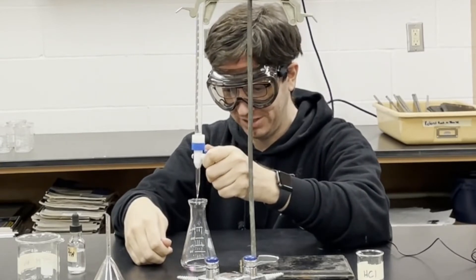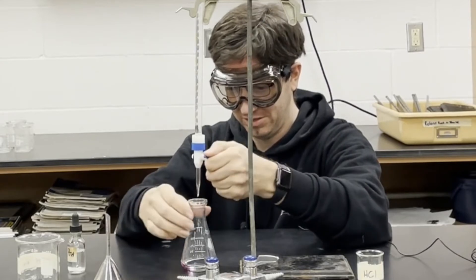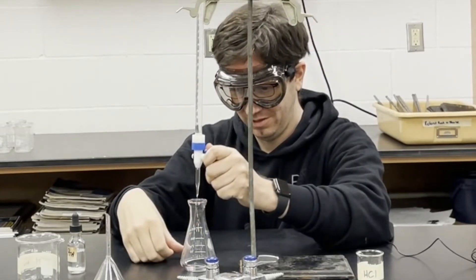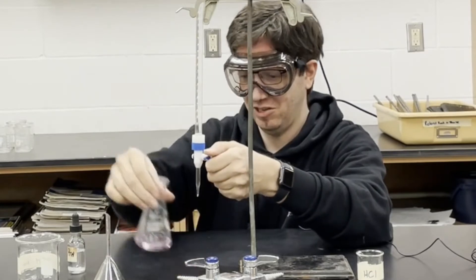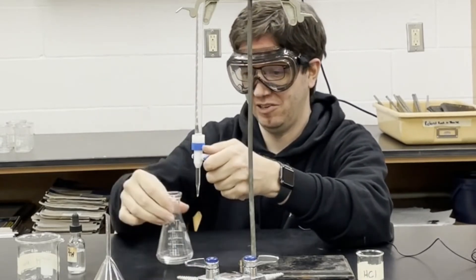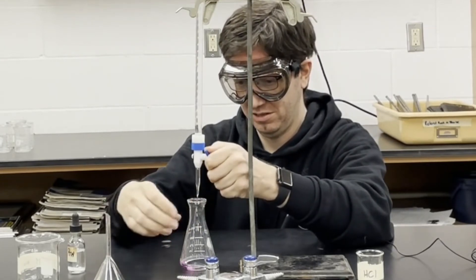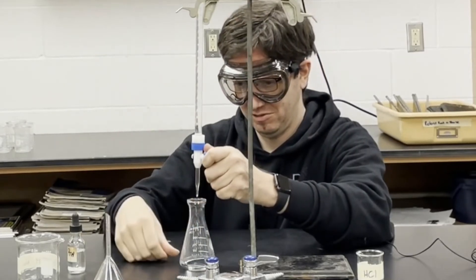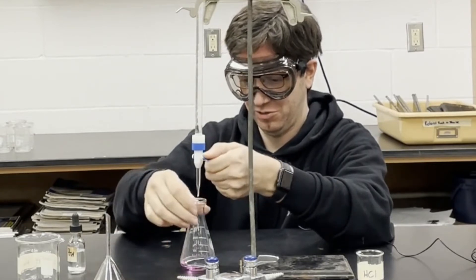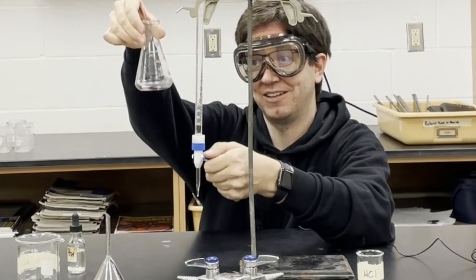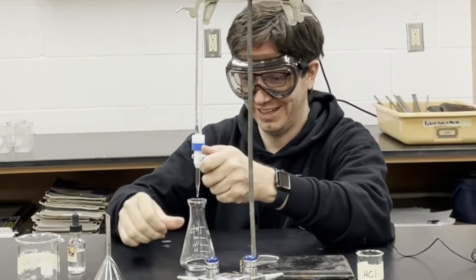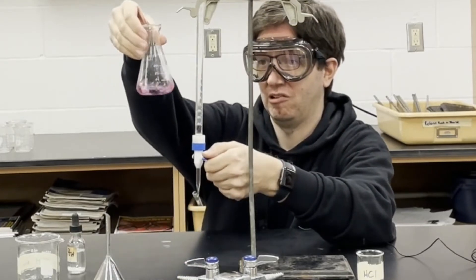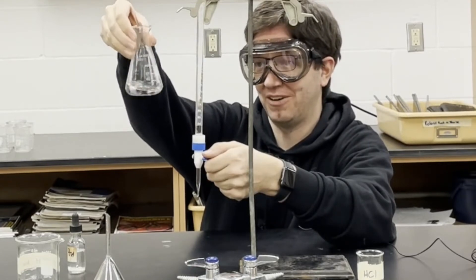We don't want to put in more than that right amount. So it's pink and clear, so we keep going. Pink and clear. We're getting very close. It took a little more time to turn clear there. Just a little bit at a time. Pink. And it's still going clear, but we're very, very close.